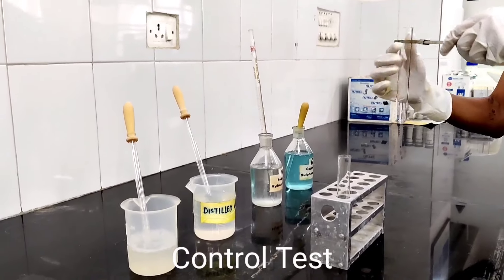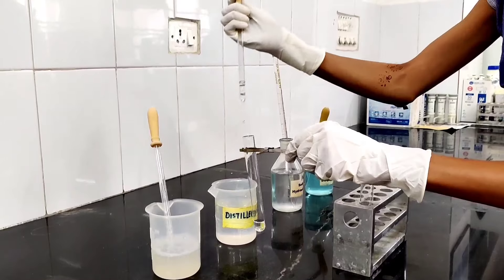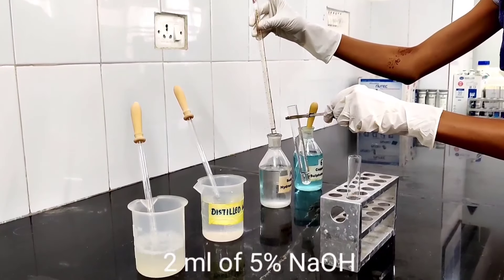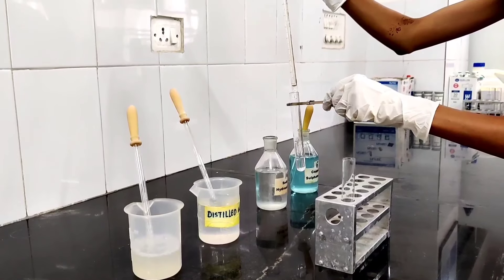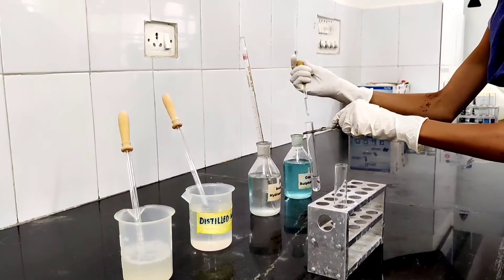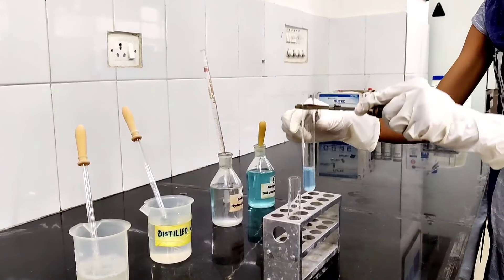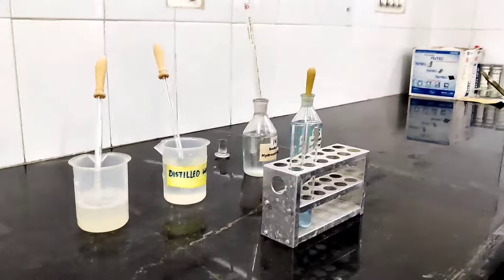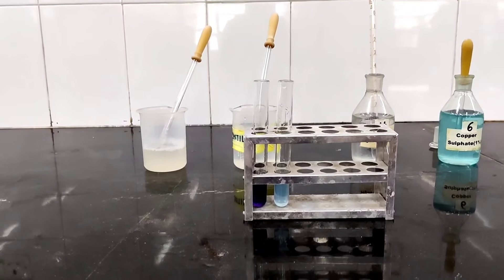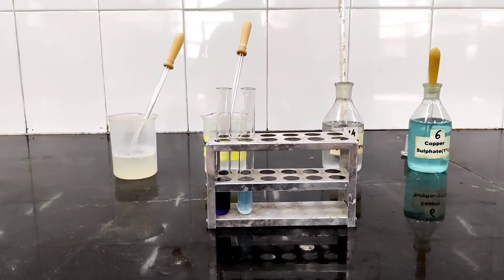Now we will do the control test. Instead of test solution, take 3 ml of distilled water. After taking 3 ml of distilled water, add 2 ml of 5% NaOH (sodium hydroxide), mix it properly, then add 2 to 3 drops of copper sulfate and mix it properly. As you can see, there is a color difference: the test solution gives violet color, while the distilled water control gives blue color. That is all about the Biuret test. Thank you.